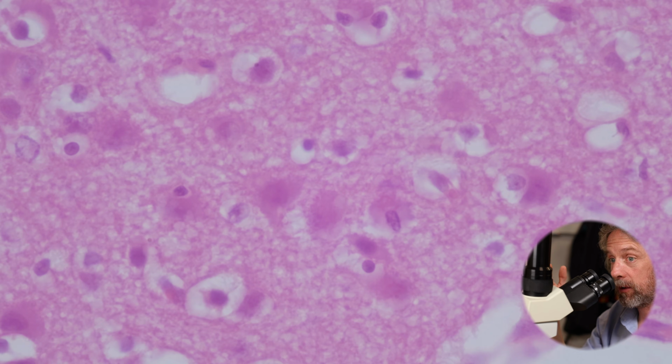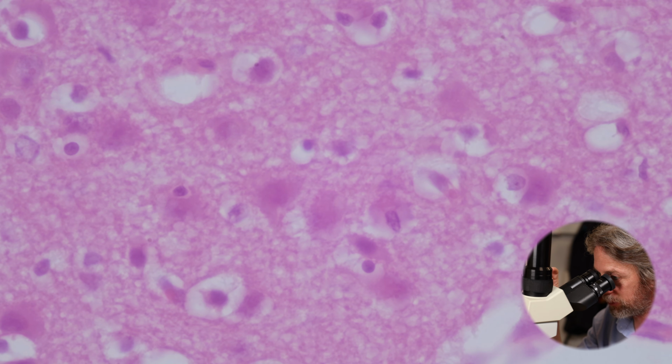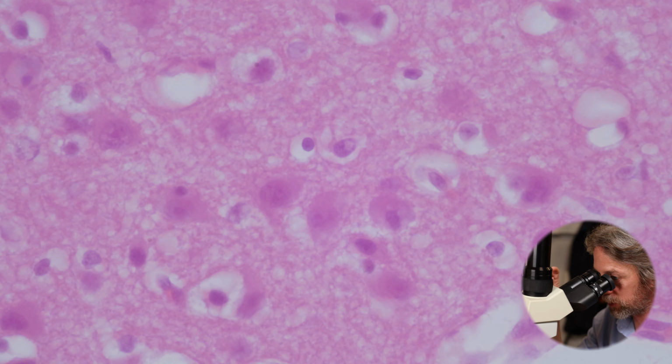we've got neurons, and then we've got glial cells. So the glial cells are the support cells. So the oligodendrocytes and the astrocytes are glial cells. It comes from the word meaning glue. Glues everything together. Pretty cool, right? The microglial cells, can you see those nuclei? There are some nuclei in there that are longer and flattened. And if we looked at the cells, we would find that they were smaller cells and they're probably a bit longer and flattened. Those are the microglial cells.